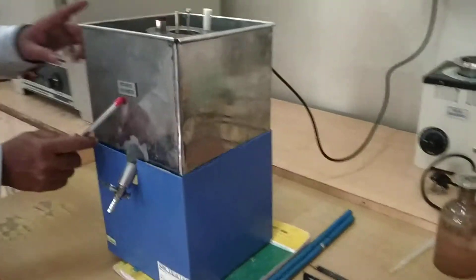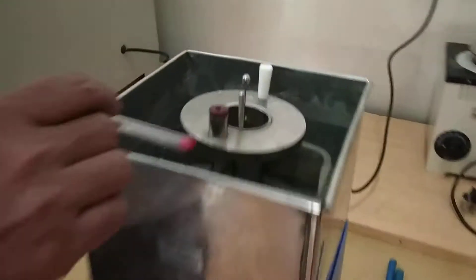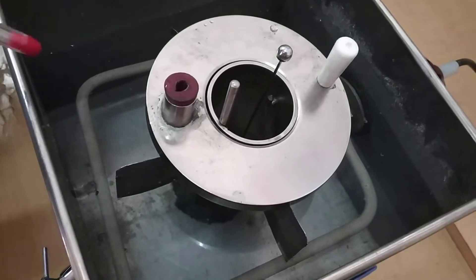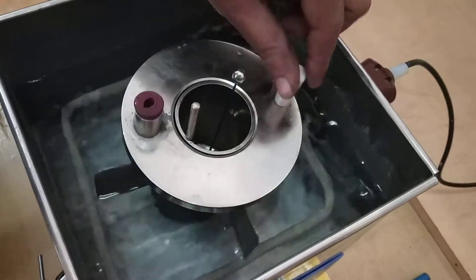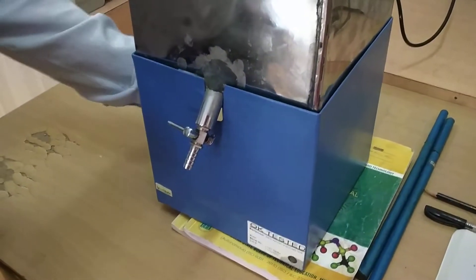Now the actual practical. This is the Redwood Viscometer. This is the water bath in which water gets filled. The water bath is full. Water gets stirred. Then the knob is closed. Here the conical flask has to be fitted at the bottom.